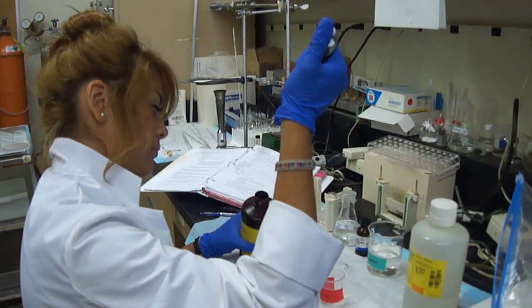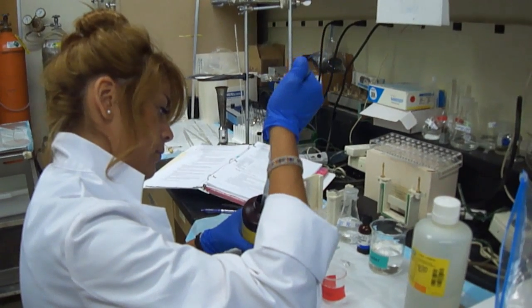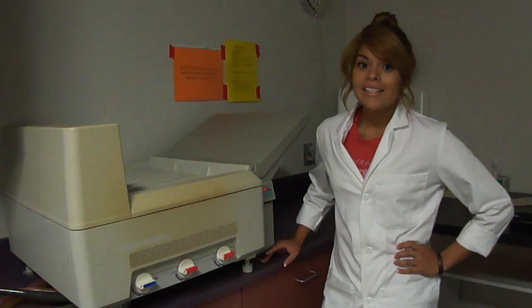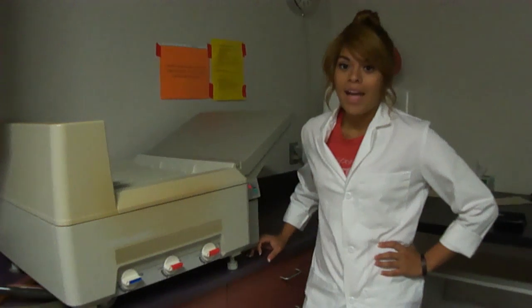We will now transfer the gel onto a PVDF membrane. We will then add blocking buffer, a primary antibody, and a secondary antibody. The secondary antibody emits a signal that can be detected by a special camera. Here in the dark room, an image will be produced using a special film. The fluorescence given off by the primary and secondary antibodies can be detected on the film, thus allowing us to use the densities of the bands as quantifiers.